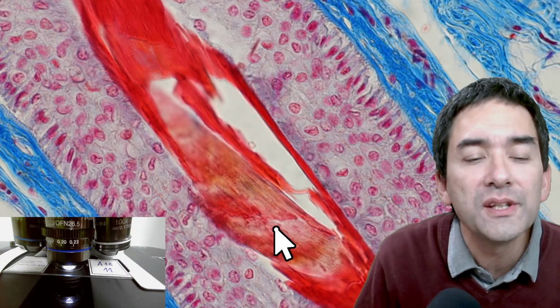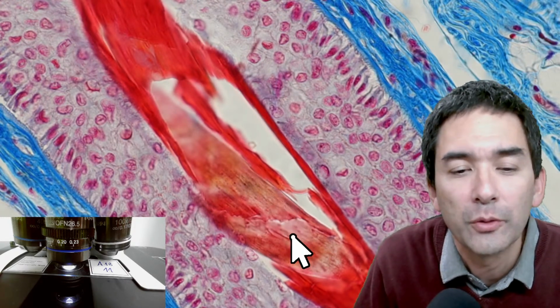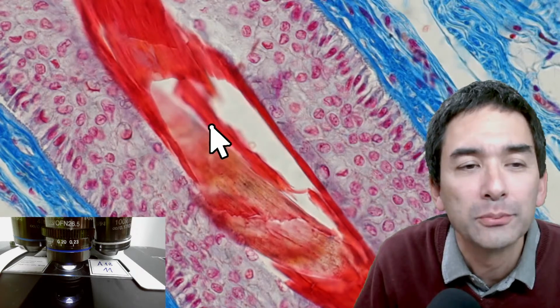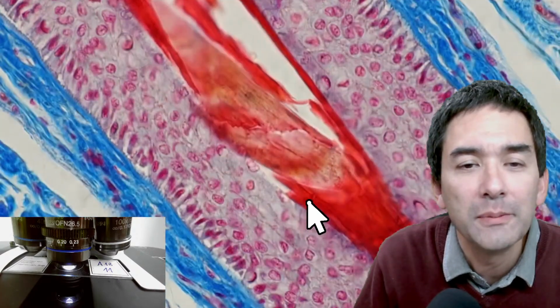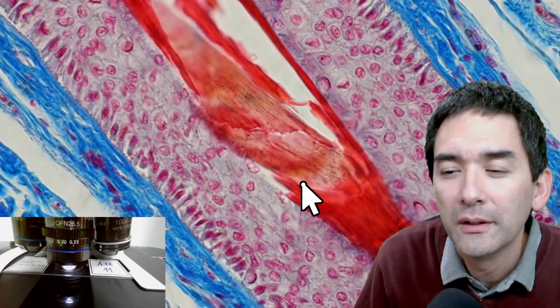And here I don't see those cells, but it looks fibrous, and I'm quite certain that this is actually the hair. The cells in the hair follicle produce the hair protein, and it looks like this because it was cut very thinly. You also see that it seems to be broken a little here, because of the protein, which was so hard.